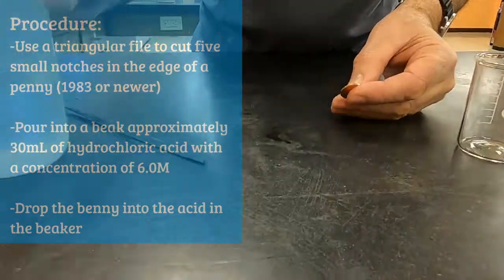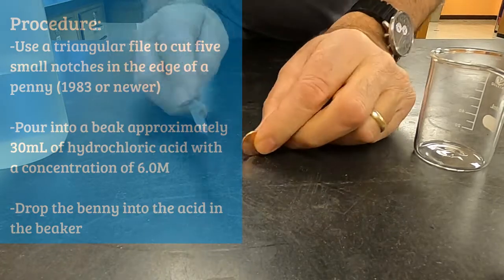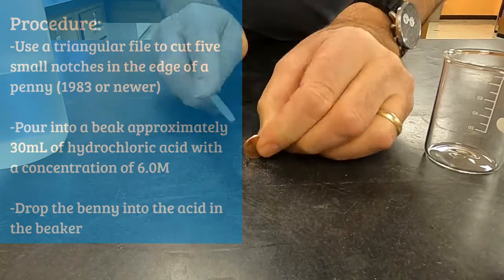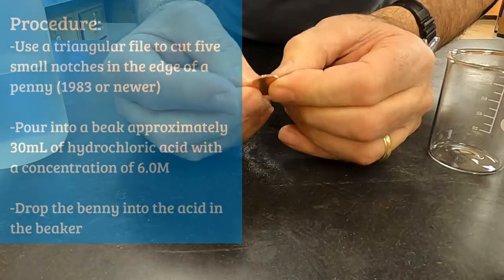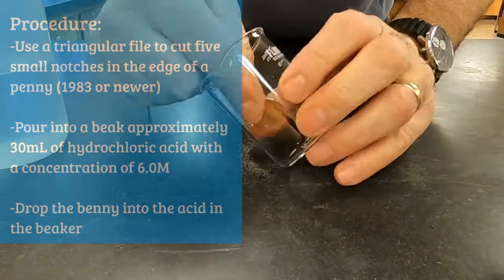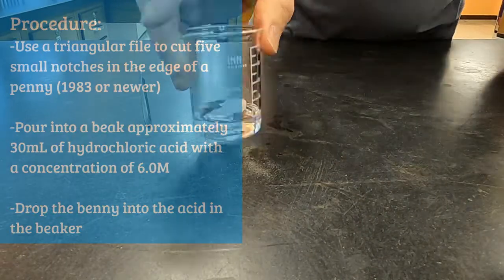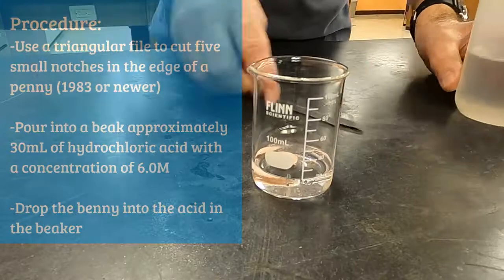This reaction is going to be between zinc and hydrochloric acid. The source of the zinc is going to be from a penny. Pennies, up until 1982, were pure copper, but after 1982, they are mostly zinc with only a thin coating of copper. So what you're going to first do is use a triangular file to make some notches to expose the zinc, and you'll see that it's a different color.